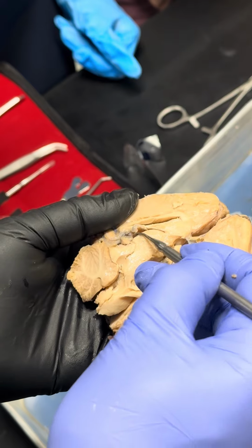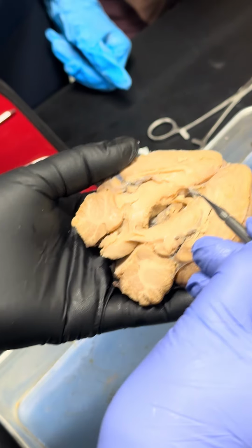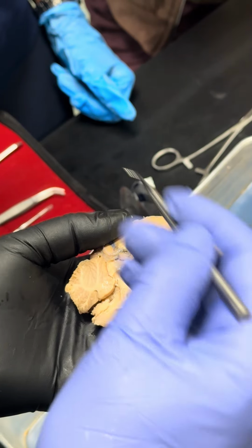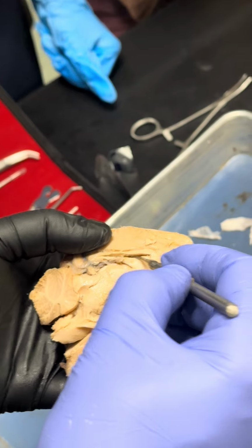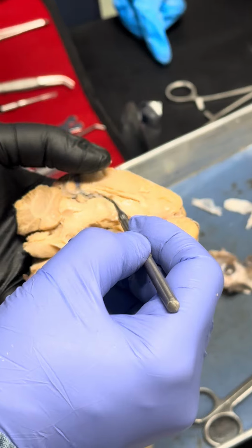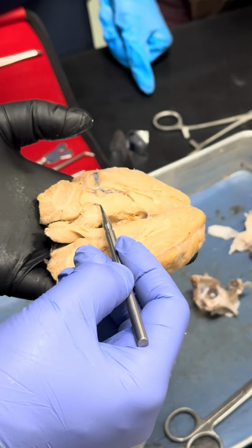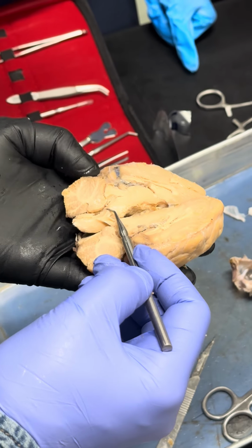And this structure, can you see this structure right here? Like capillary, it's called choroid plexus. This capillary secretes cerebrospinal fluid, okay? They are found in the lateral ventricle as well as in the third ventricle. And third ventricle continues here, okay? Third ventricle continues, and this is a cerebral aqueduct, okay?